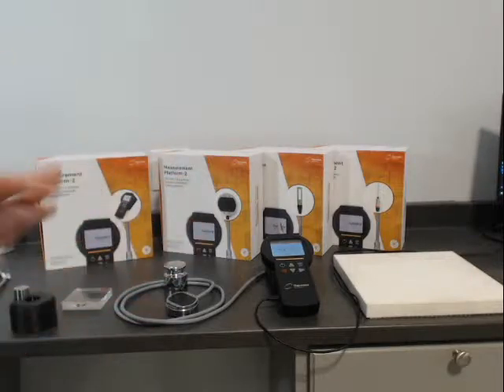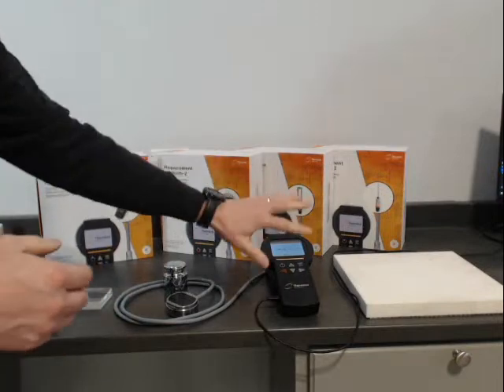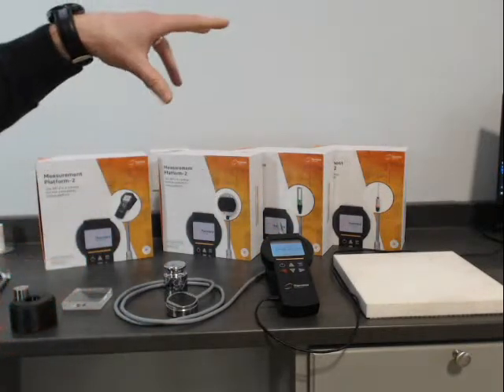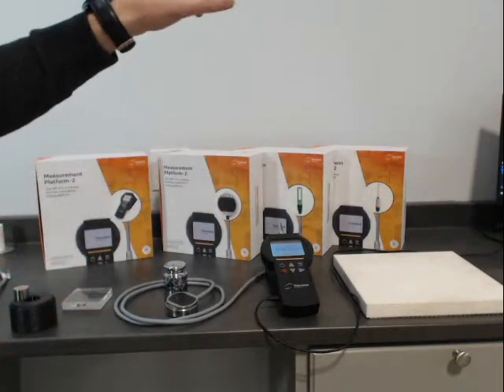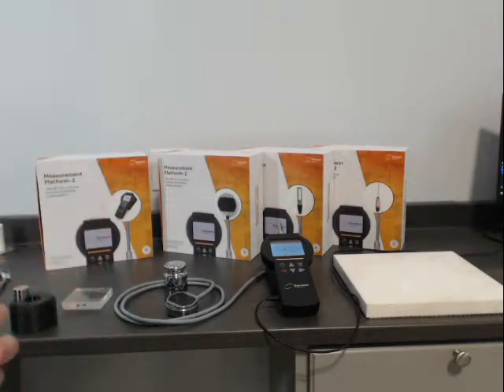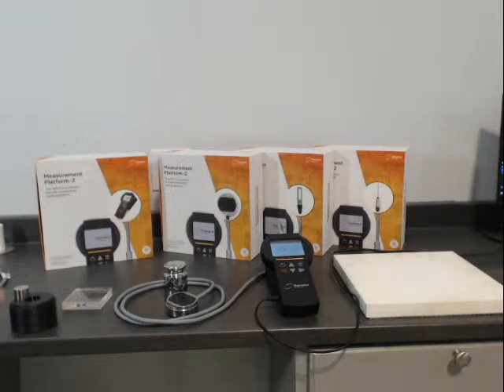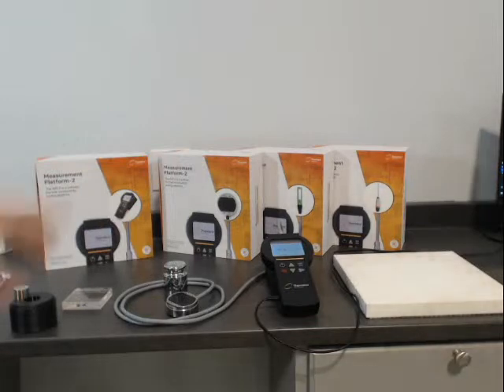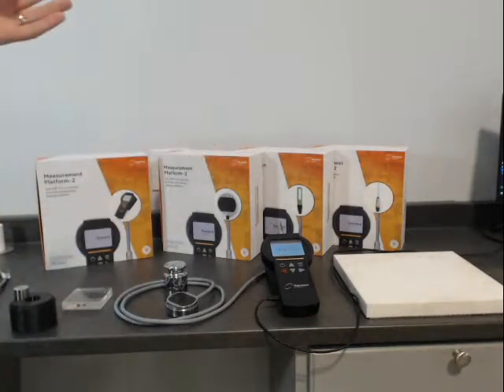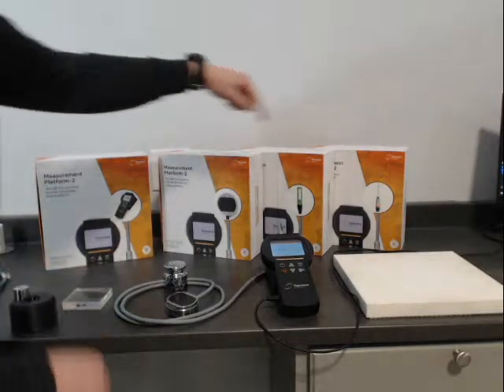So it's a pretty powerful unit. You can handle everything from the controller, but you can also schedule devices through the utility application that's available. If you have interest in this and go to our website, these are only three of the sensors — there are at least three more additional sensors available, which are modifications of these.